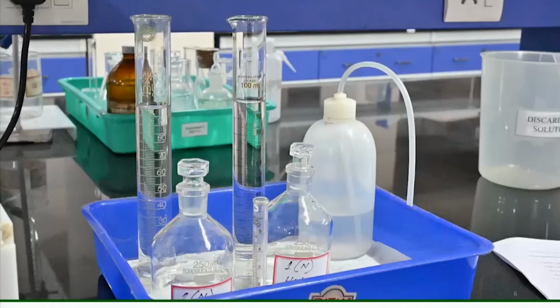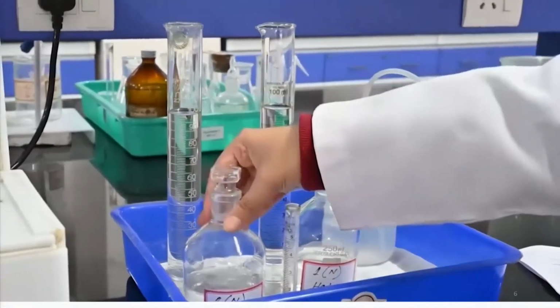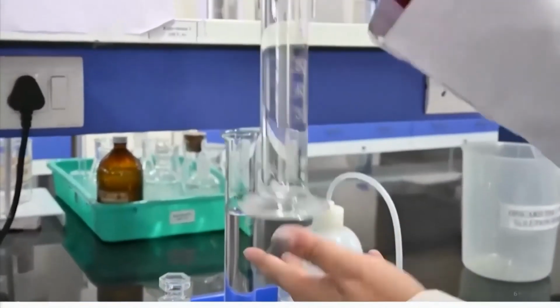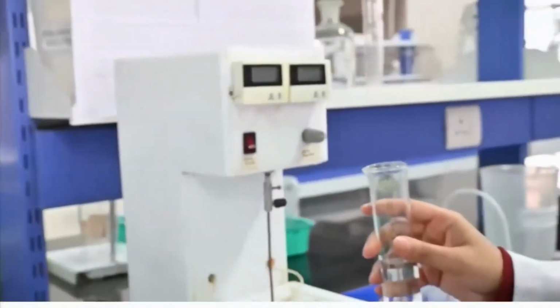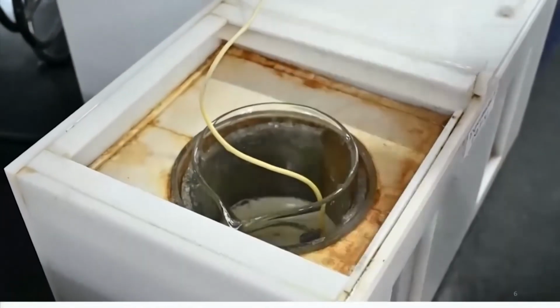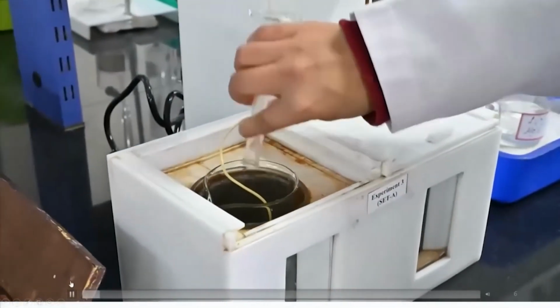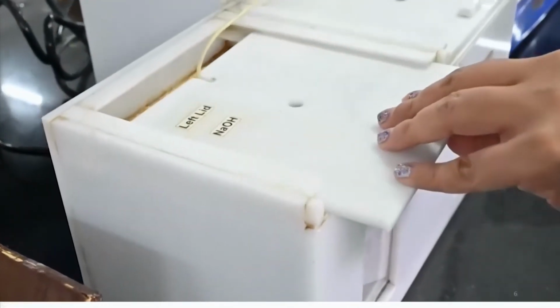So, let us now have a look at how the actual experiment is done. So, first what we will do is, we will take the sodium hydroxide solution and then take 100 ml in the bigger measuring cylinder, and then in the left hand side compartment I will pour the entire 100 milliliter of sodium hydroxide solution, which is one normal, and I will also add the additional 1 milliliter that I have here.